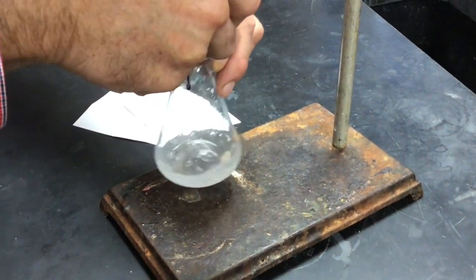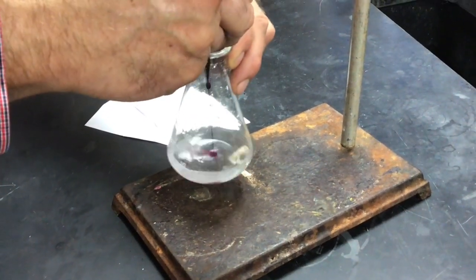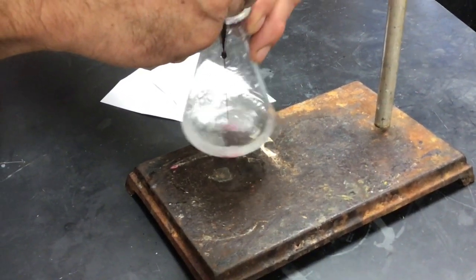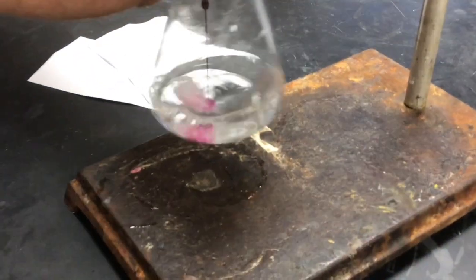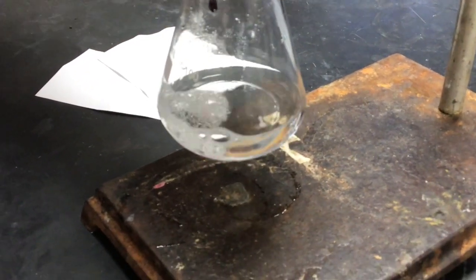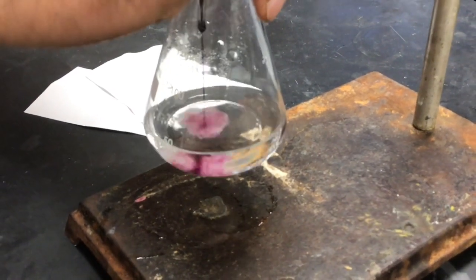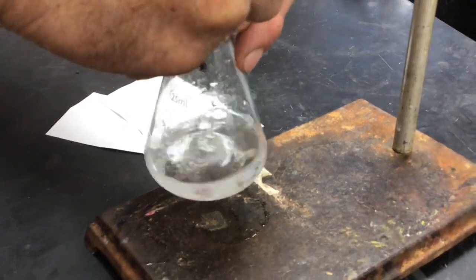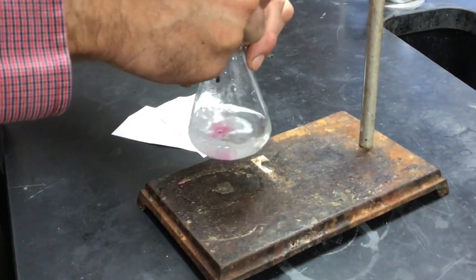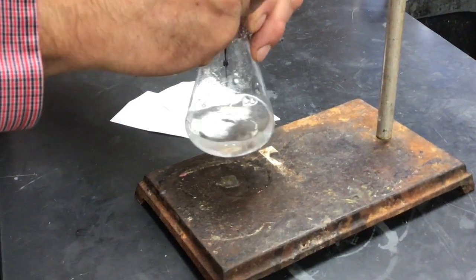A lot of transition metals are like that. They'll be a different color for their different oxidation numbers. And manganese is one of those. Yeah. Now, there's something else going on there, Mr. Moore. It's not just a color change. What else do we see happening? Is that bubbling just from mixing the liquids together? It doesn't look like it. I think the bubbles are part of the reaction. Part of the reaction, yes. When we look back at our chemical equation, when you do a lab, it's important to connect what you see in the chemical equation and make sure it's consistent with what you're observing.